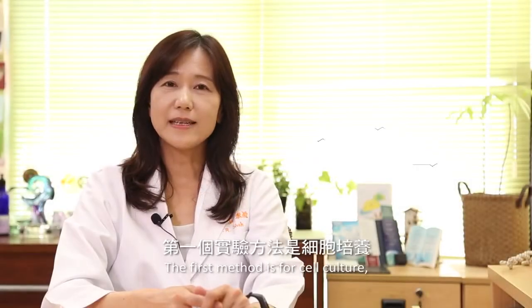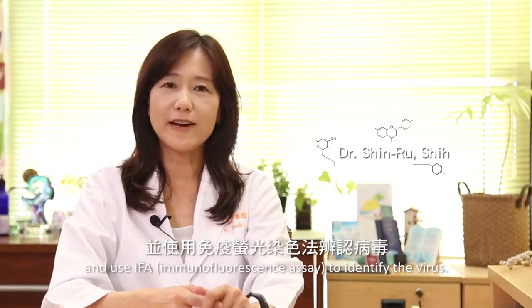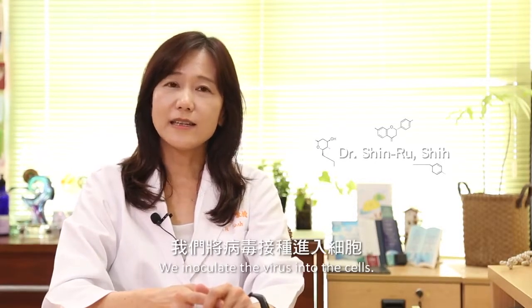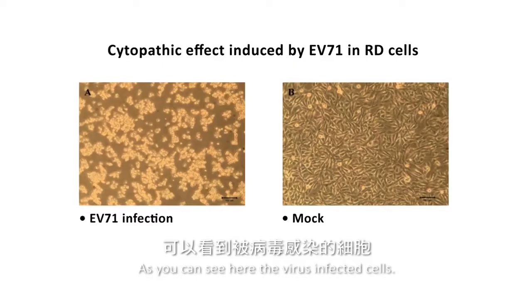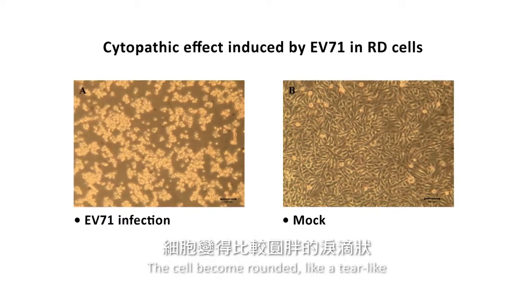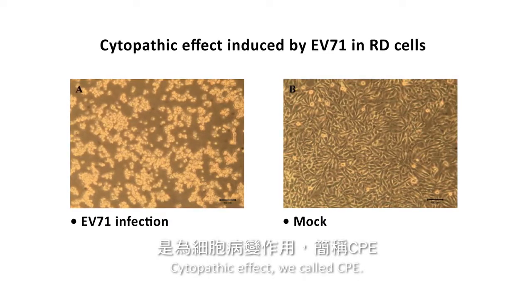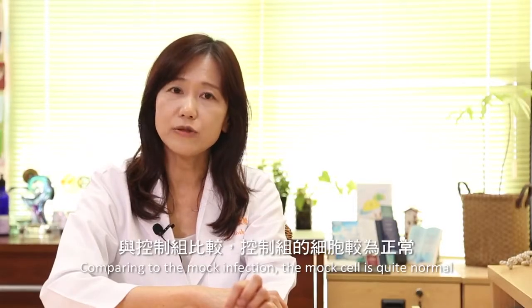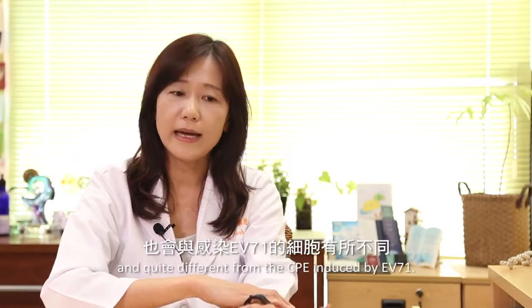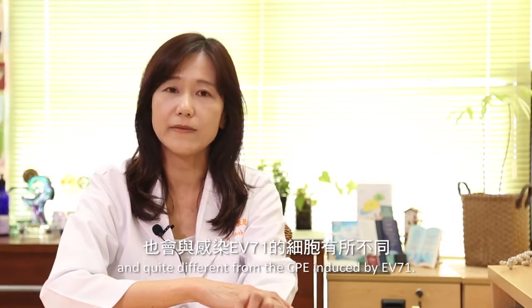The first method is cell culture and use IFA to identify the virus. We inoculate the virus into the cells. As you can see here, the virus infects the cell, which becomes rounded like a tear, a cytopathic effect we call CPE. Compared to the mock infection, the cell is quite normal, and quite different from the CPE induced by EV71.